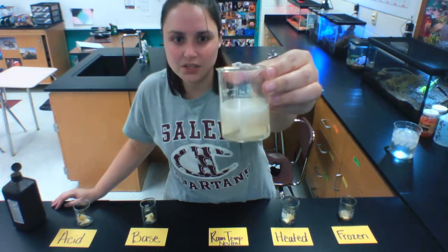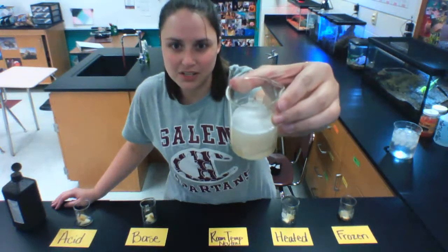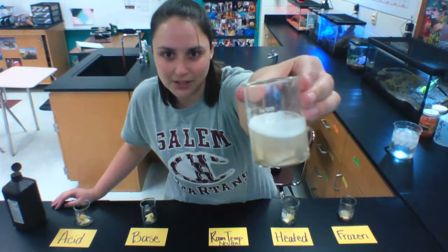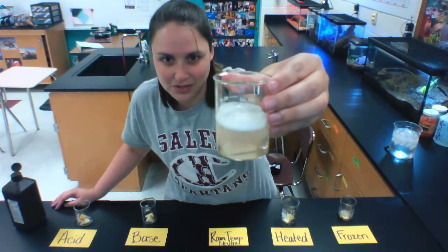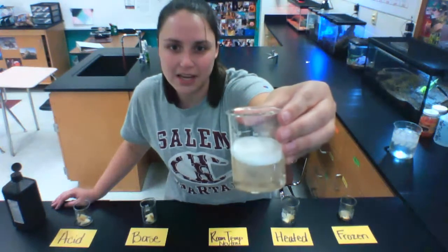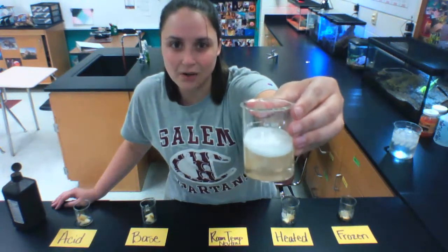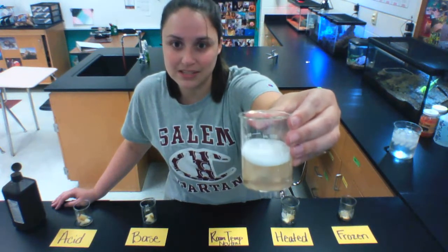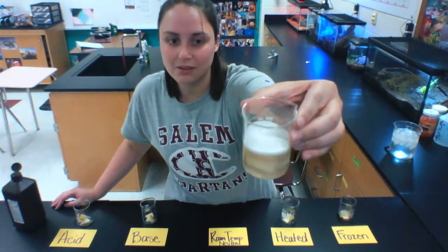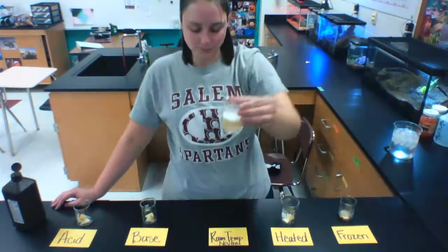So what you can see here is bubbles starting to come from the potatoes. Are you seeing the bubbles? You can see it bubbling up on the top of this beaker. You can actually see the bubbles coming directly from the potatoes if you look closely there. So this one is having a reaction. The peroxidase in those potatoes is breaking down the hydrogen peroxide. And when the hydrogen peroxide is broken down, oxygen gas is released as a byproduct. So those bubbles are actually the oxygen gas that's being released.